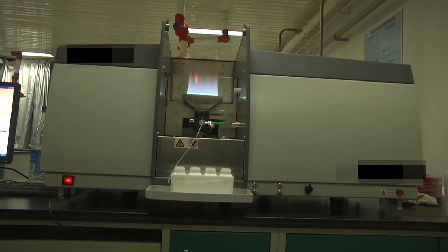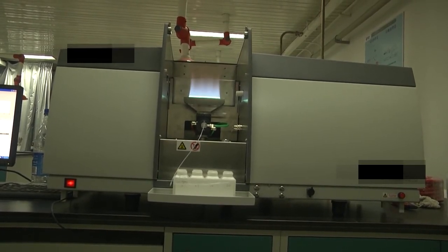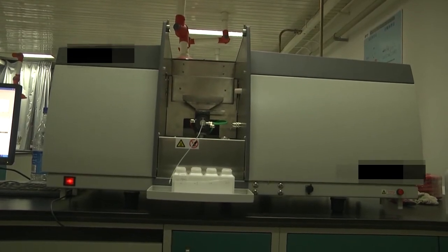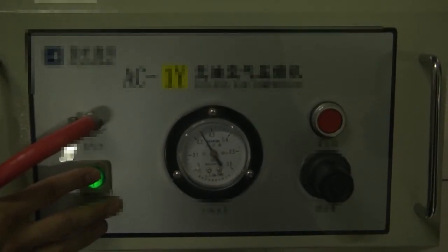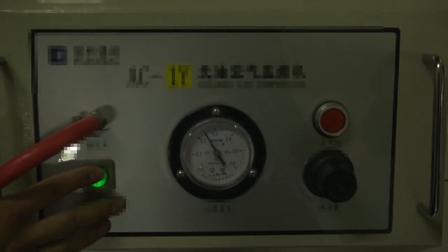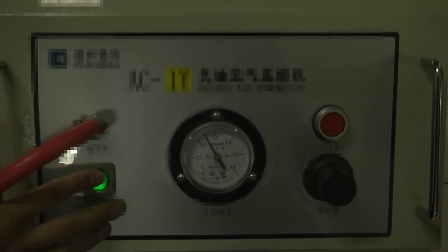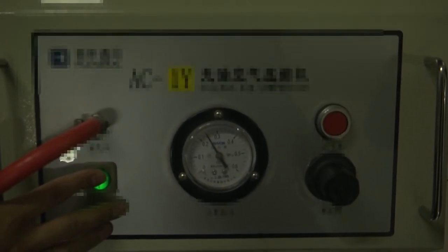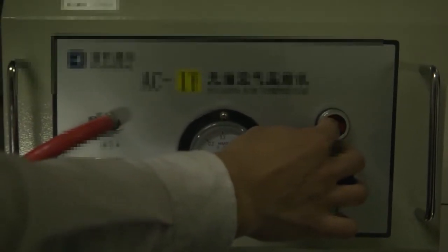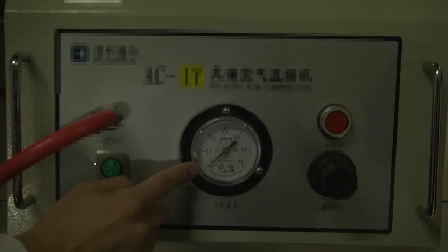To safely switch off the flame, first you need to switch off the gas valve, and then flame is off. The gas is completely burned in the pipe. Next is to switch off the air compressor. Press off the power button and press down the release valve until the meter turns to 0 position.